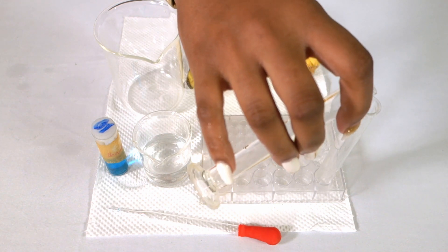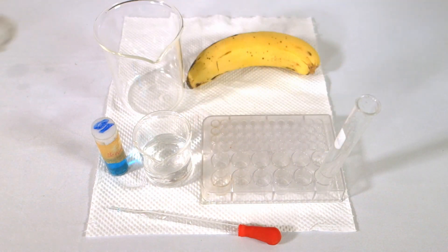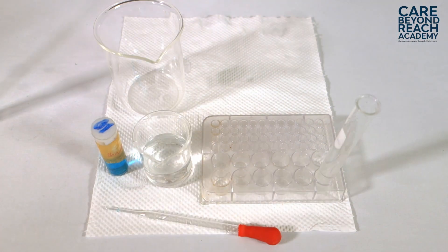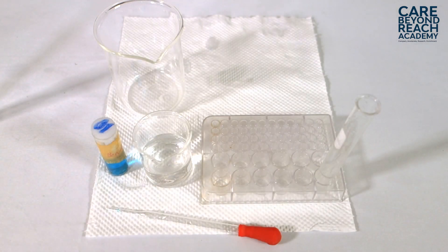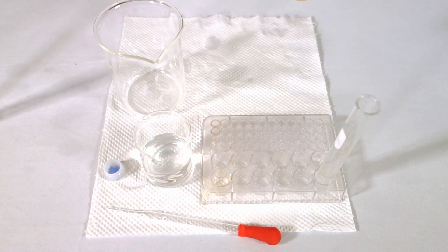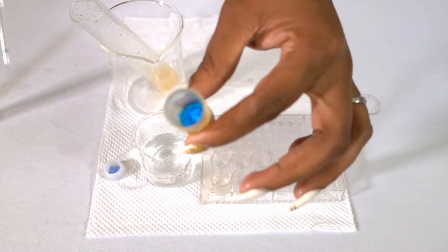We go ahead and pour this glucose solution in a test tube, after which we go ahead and put the banana in solution as well. Once we put the banana in solution, we can then go ahead and add Benedict's solution to each of the mixtures that we have.